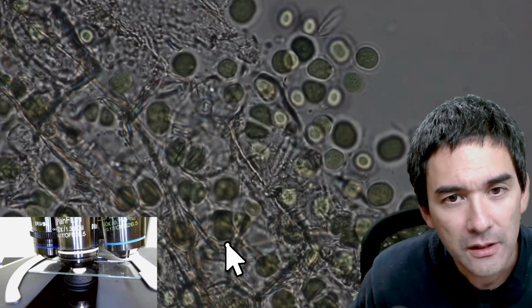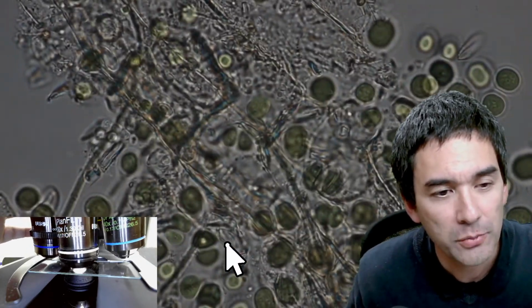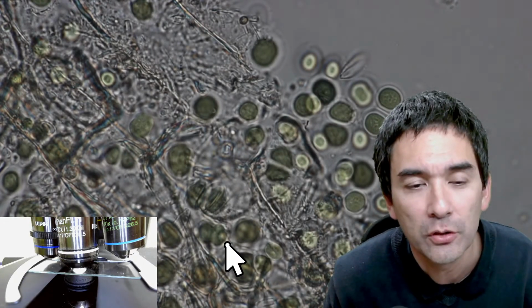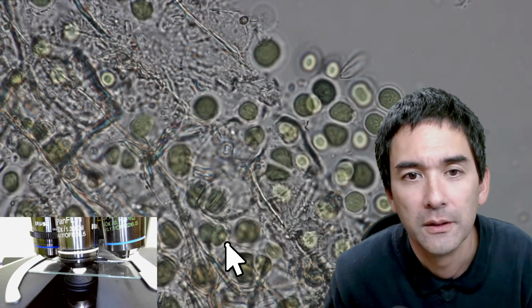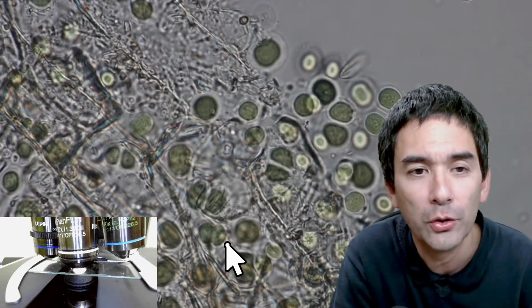Yeah, and then what some people do is the following, because there might be a little bit of bubble in here. Some people actually go it like this and distribute it. Okay, and I think you might be able to see now that it actually is, I'm going to increase the brightness, yeah, much more clear. Yeah, it is not only brighter, but also more in contrast.